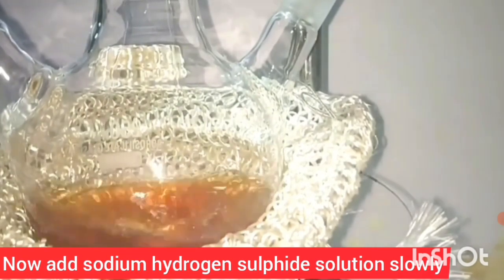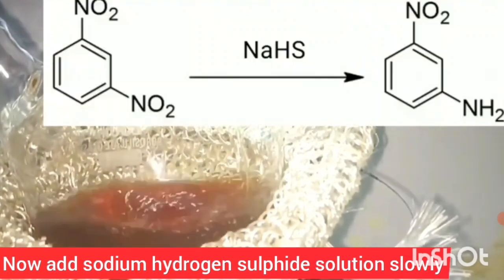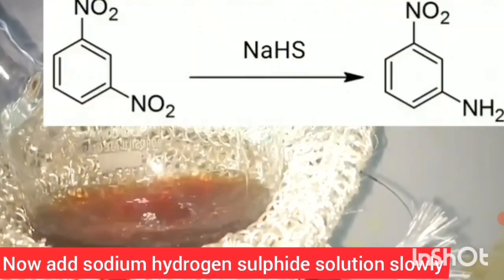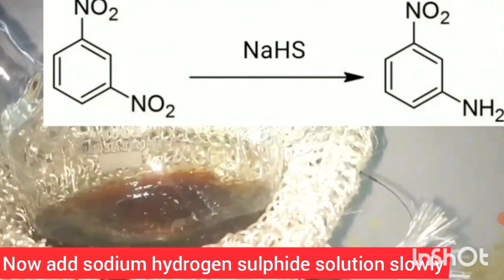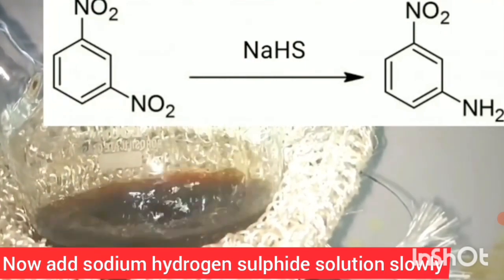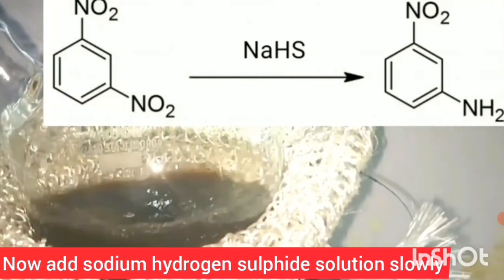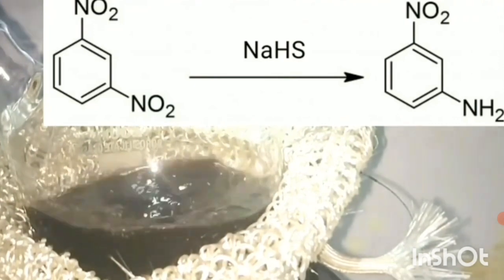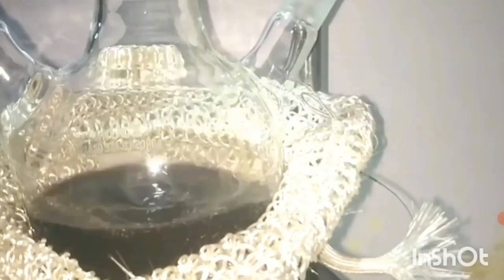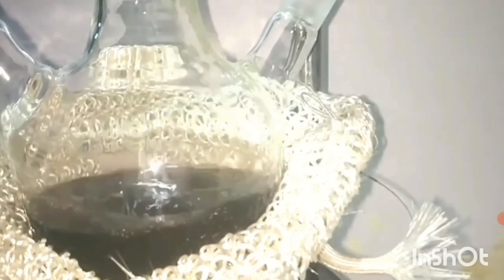The reaction has now started. The nitro group is going to be reduced to NH₂. The addition of hydrogen or removal of oxygen is the reduction reaction taking place here.